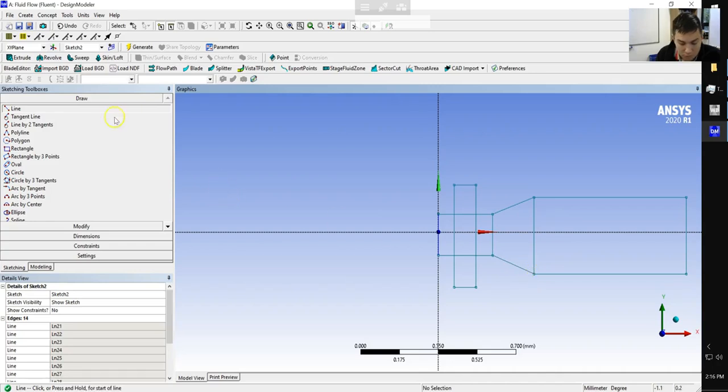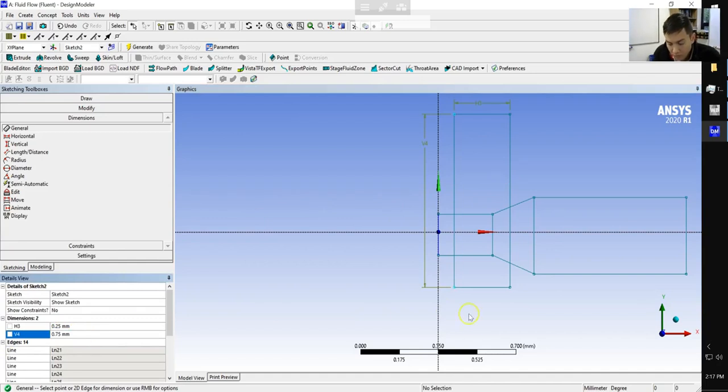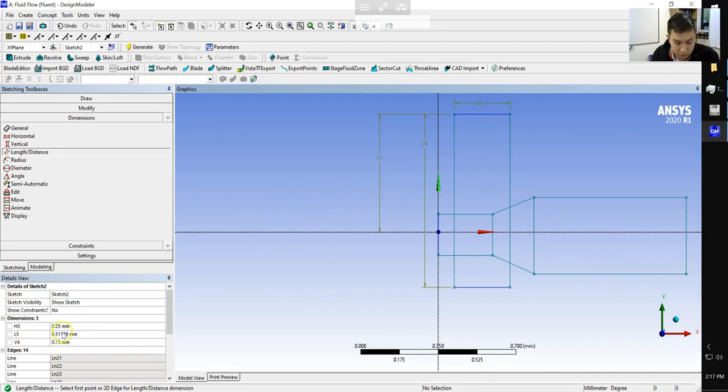Okay, so let's go ahead and do some of the dimensioning. Again, our inlet width is going to be 0.25. Again, not quite the right size, but that's okay. The overall length of this rectangle, we're going to set as 3 times that length, so that's going to be 0.75. And we're going to want it centered, so the distance from the x-axis to the inlet will be half of 0.75, which would be 0.375.